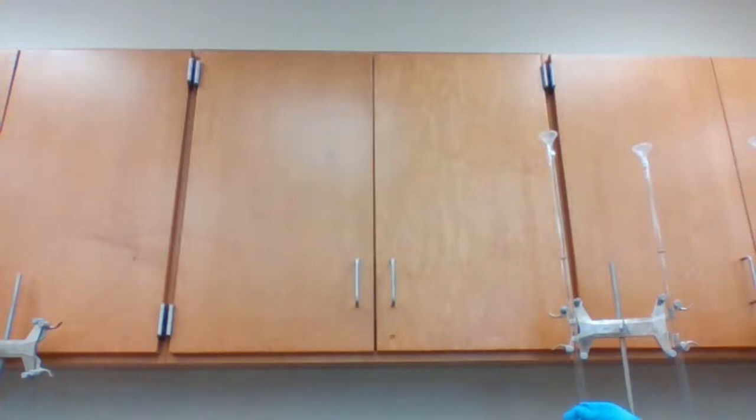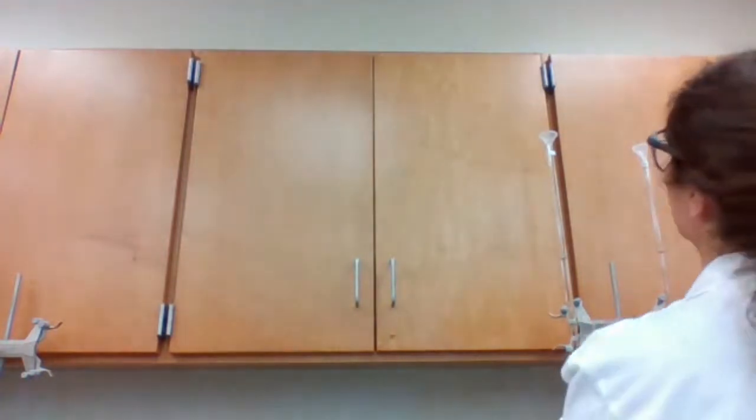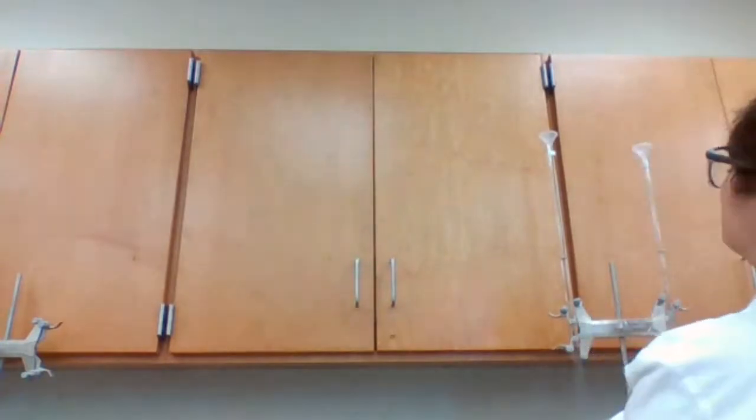Okay, I need 4 milliliters of the KI. So I'm going from 19 to 23.